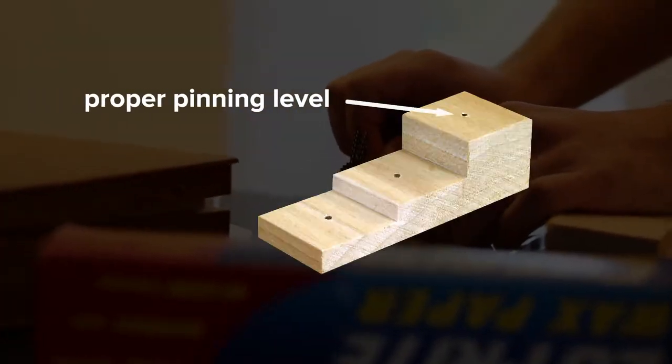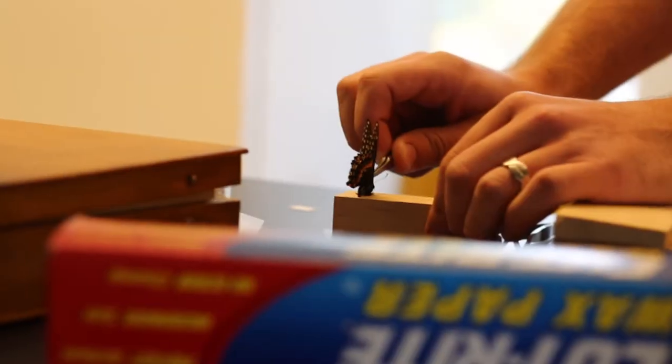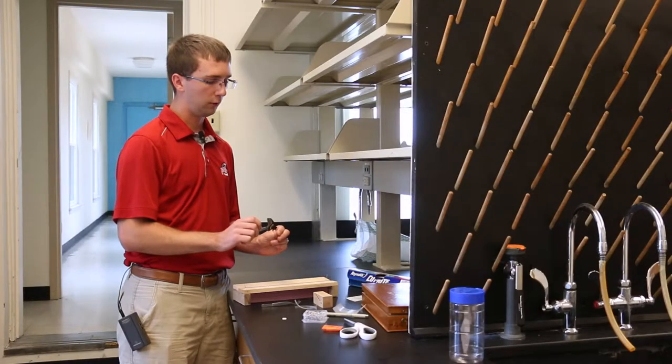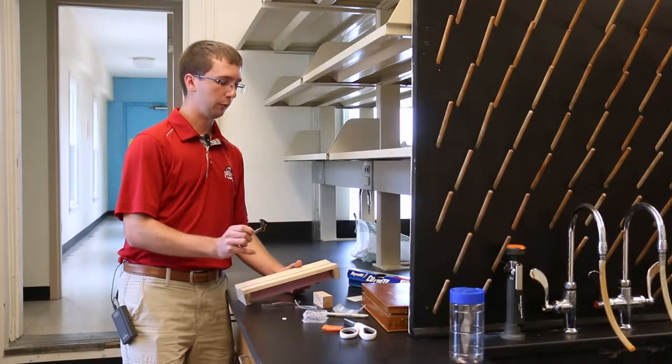If you don't have the right height it's a lot easier to break the specimen's antennae and rub the scales off the wings. Next I take the forceps and grab hold of the pin again, and this is another crucial part to spreading it properly.